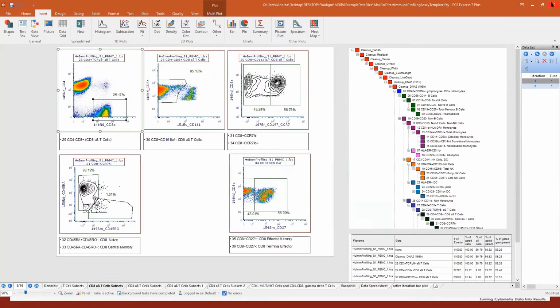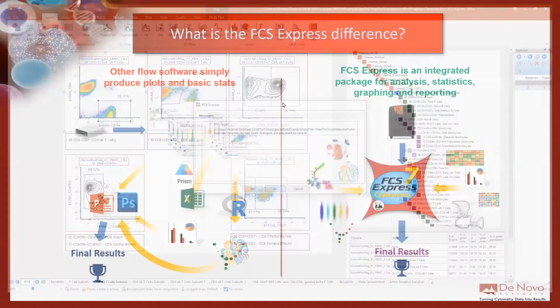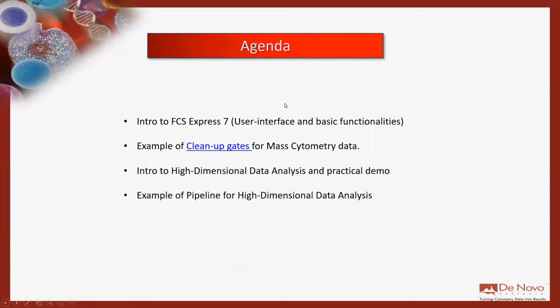Okay, so this is the idea of FCS Express, having data analysis and data reporting and graphing tools all embedded into the same platform, a PowerPoint-like platform. So it's a very user-friendly interface. So let me close this and move on to the first part of the presentation. I want to show you how to create plots and gates, and give you an idea about how easy it is to use FCS Express.